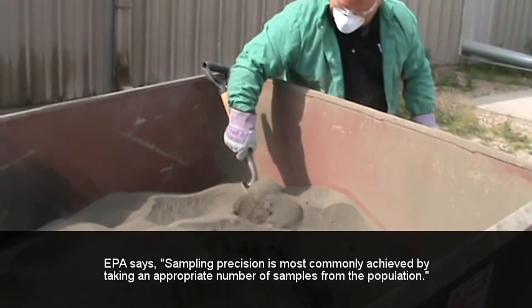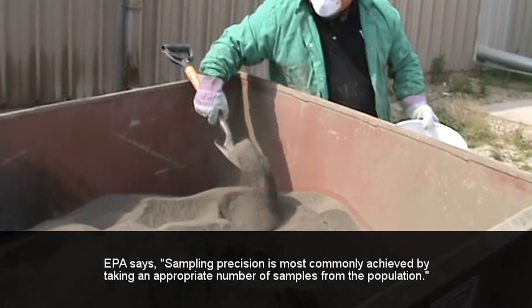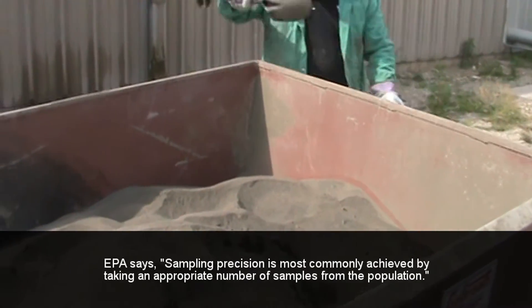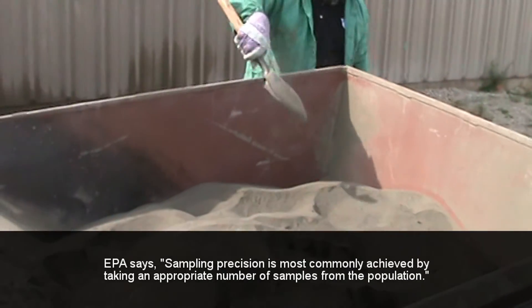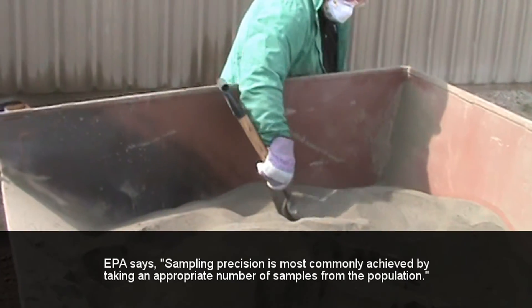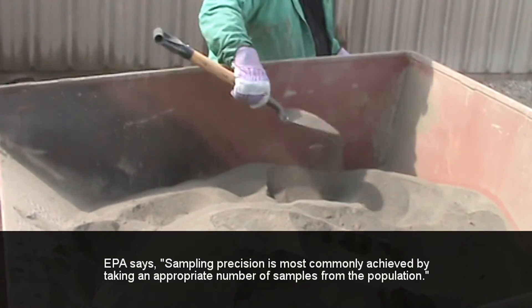Many assume a simple grab sample is sufficient for testing. However, such a small sample taken from a single region of the entire waste pile is not representative of the whole.